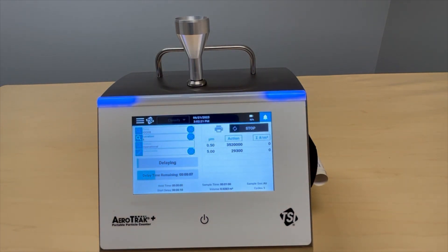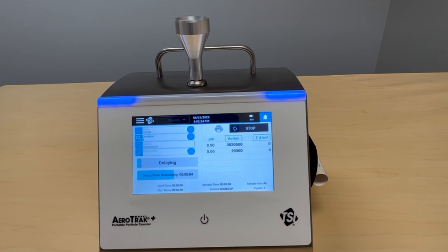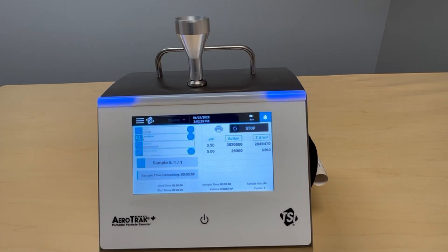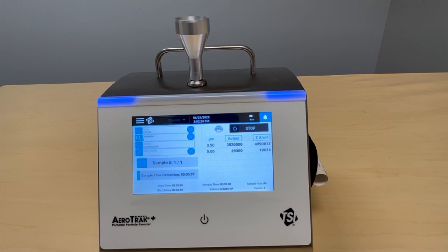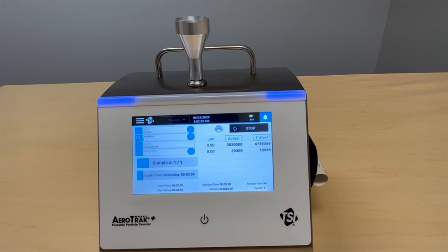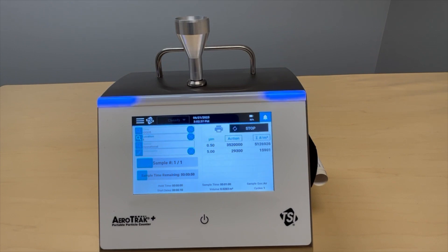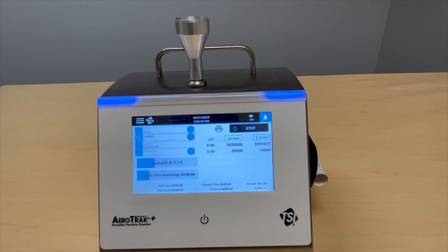Once the sample has initiated, the light bar shows a solid blue to indicate that it's initiated. It'll start flashing once particles are sensed. If no particles are sensed, it'll stop flashing. If you hit an action or an alert limit — we only have action limits in classify — you'll get a red alarm.